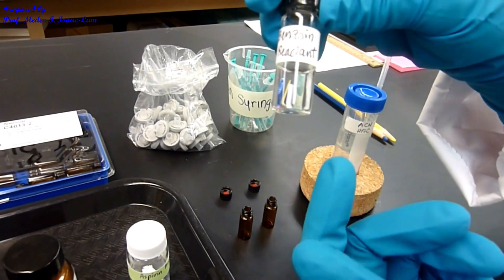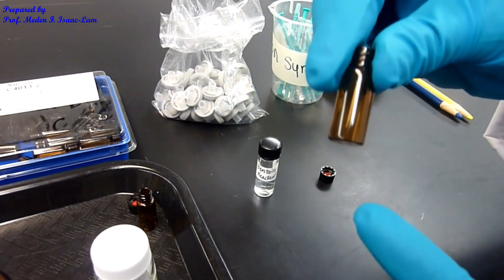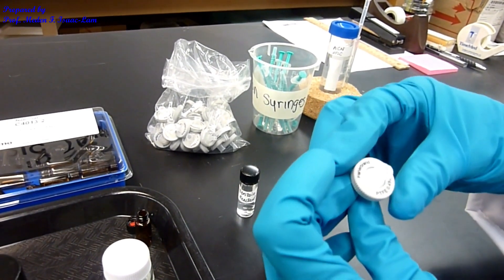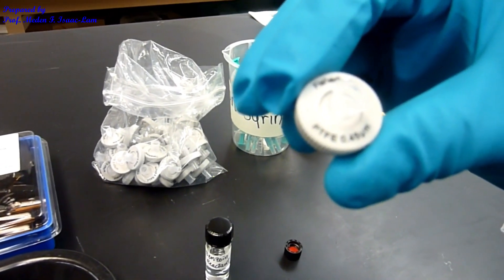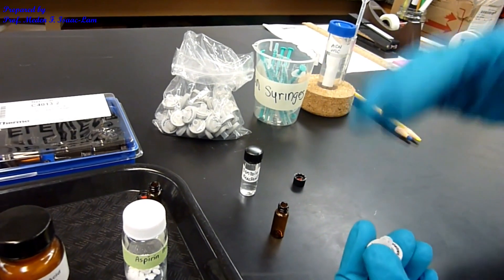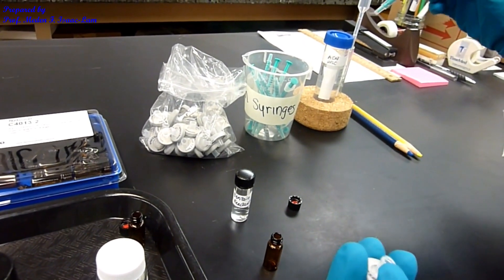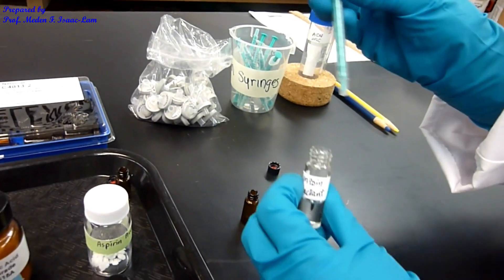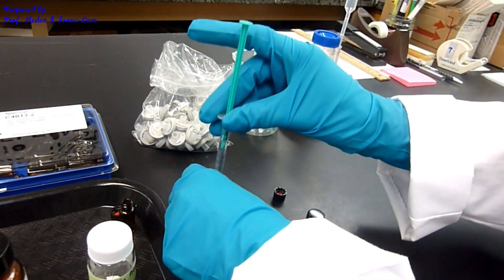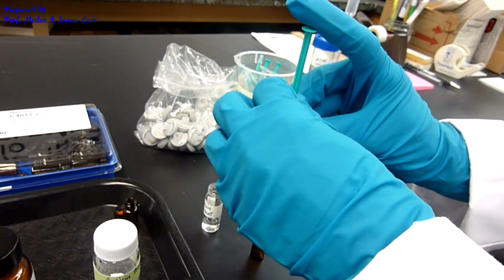This is the sample — I'm going to vortex this. The next step is to filter that solution, 1 milligram per mL, into the HPLC vial, a small HPLC vial. We're going to use a 0.45 micron PTFE filter to filter out any undissolved particles in that solution so that we can maintain the integrity of the HPLC column, because the HPLC column is expensive. I'm going to use a plastic syringe, withdraw a mL of the sample, attach it to the filter, and then filter it through into the HPLC vial by pushing it.